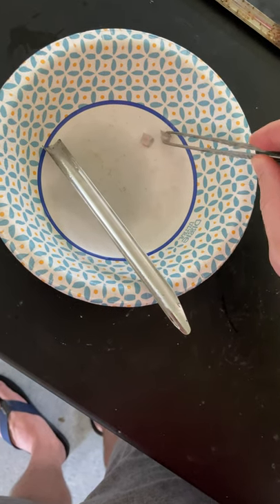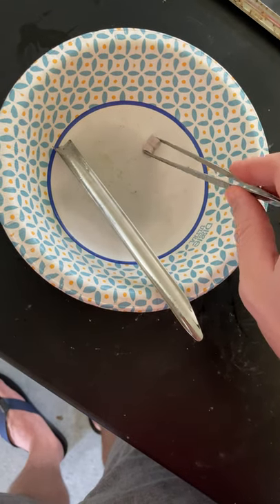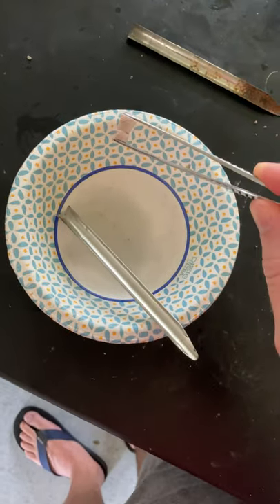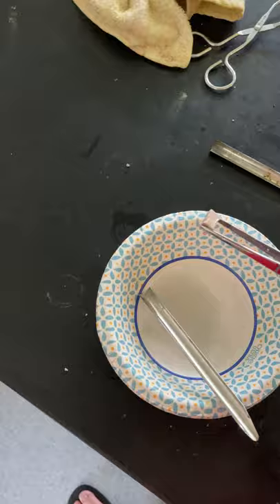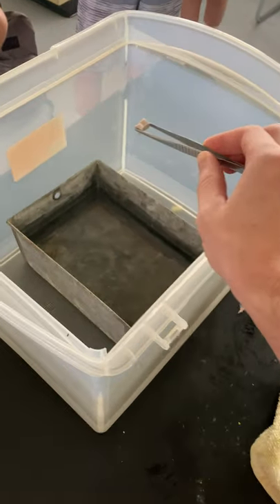Now for this reaction I'm going to suggest that everyone stand back a short distance. So I'm going to take both those pieces that I cut apart and put them in the water over here, and we're going to see what happens.